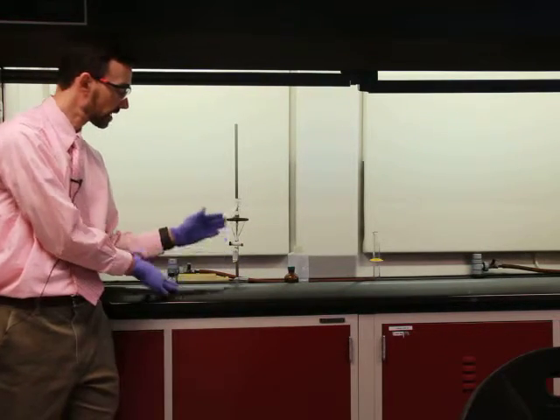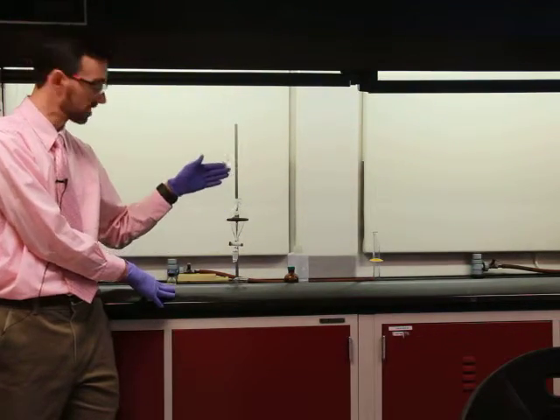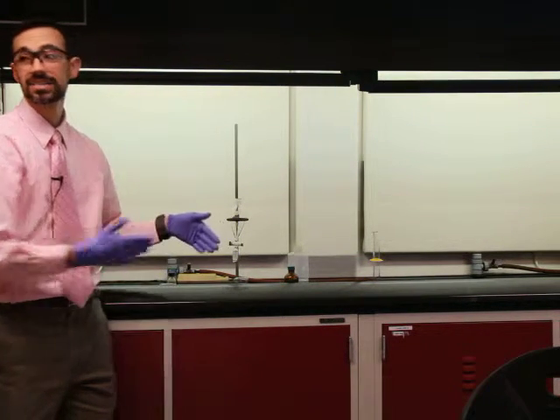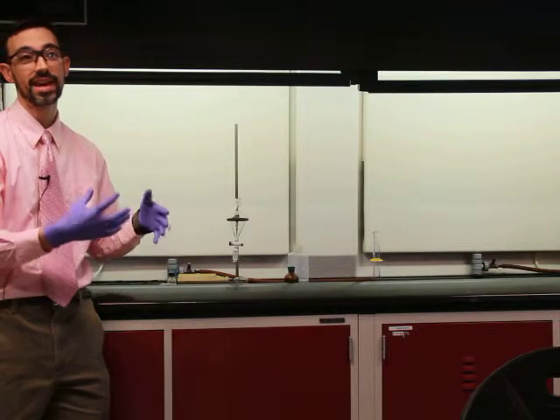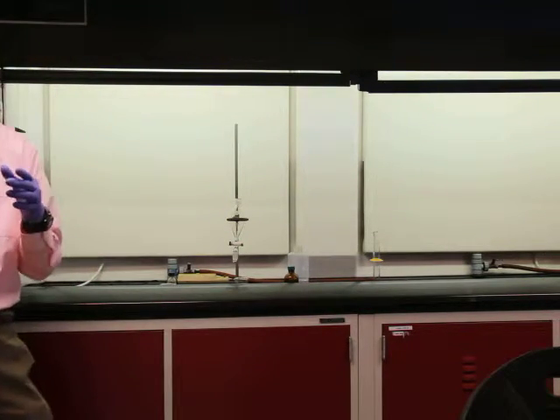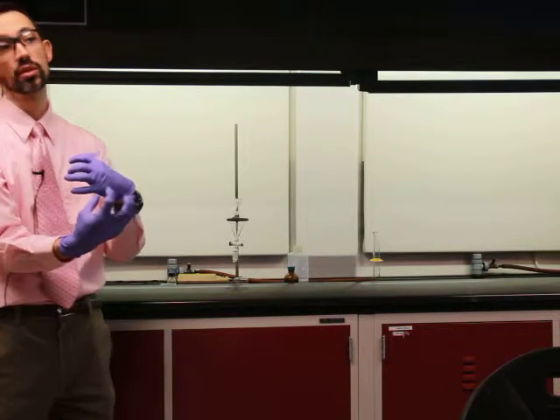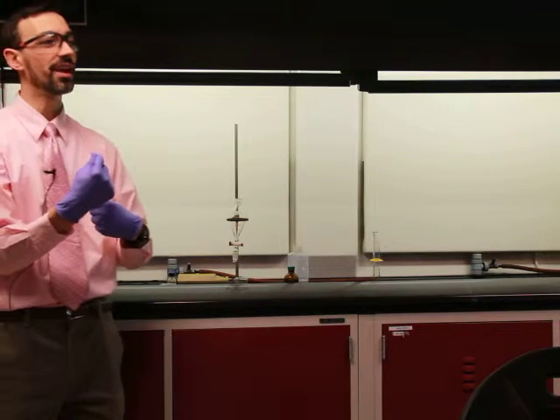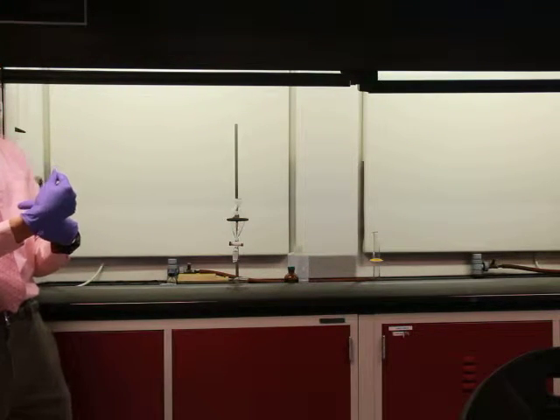When the acid molecules go into the base, they actually react with the base. So they're not acid molecules anymore. They've had their H's, which define them as acids, torn off and replaced by a sodium, in this case from sodium hydroxide. So I need to undo that reaction and get my acid back.